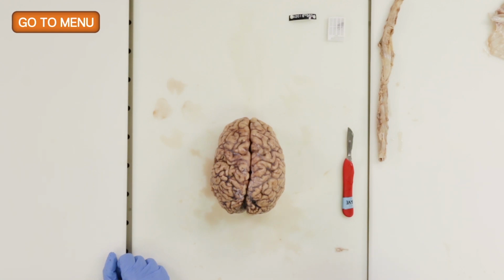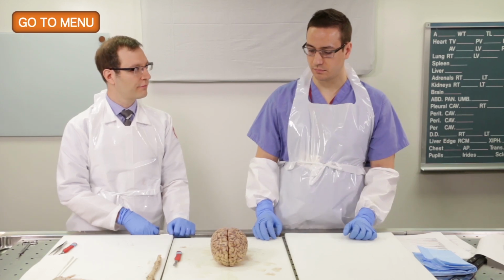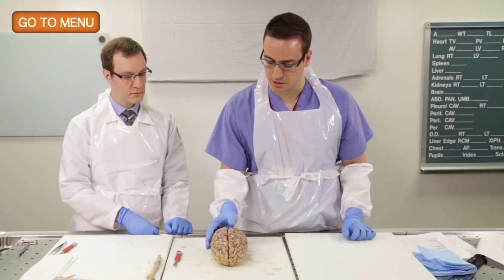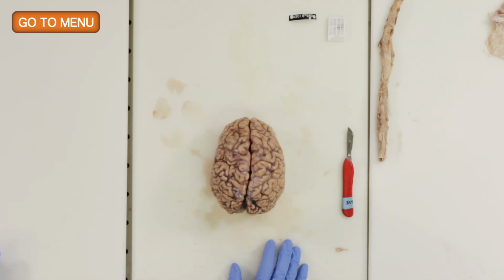Okay, so let's take a look at the exterior surface of the brain, and you can tell me what types of things we might be looking for. Okay, so the first thing I'm looking at is just the meninges covering the surface of the brain, just to see if there's any opacities or anything that might lead you to believe there was an infection with the brain.